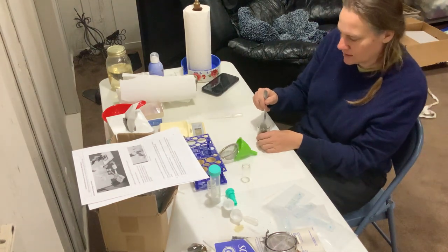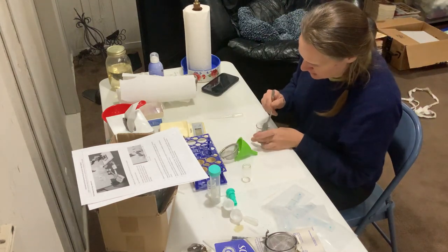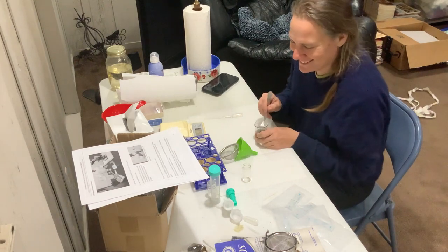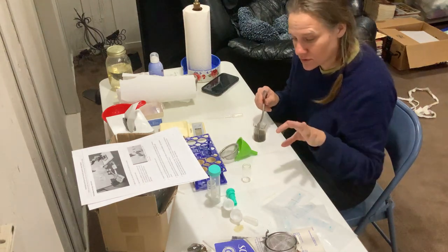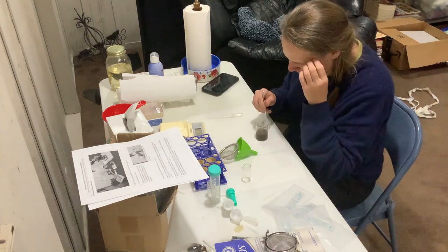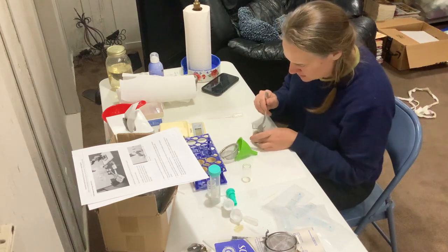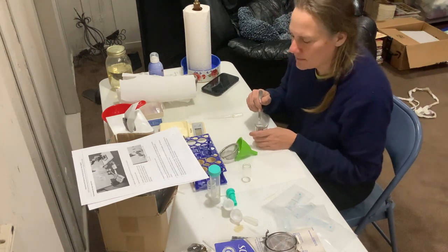So I've mixed this for probably five minutes. I feel like it's pretty good distribution and pulverization. What we're doing is those are a ton of fibers in there all packed together, and within those fibers there are hidden eggs — it's like an Easter egg hunt. The flotation device works like floating an egg in salty water, but this is just sugary water. We're stirring this up, breaking apart the fibers and releasing their eggs, and this flotation solution is making them float to the top. I have two grams in here and then 28 ml of the flotation solution.